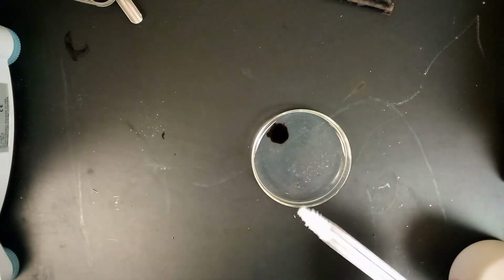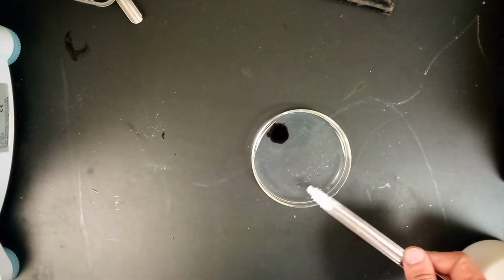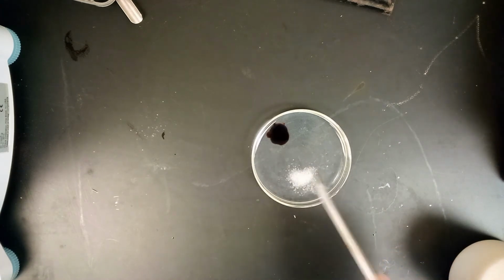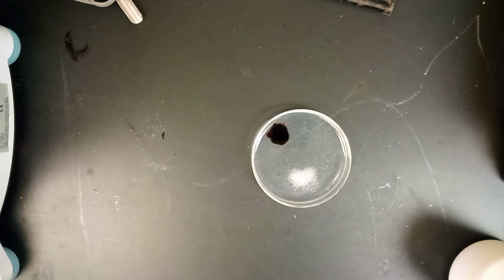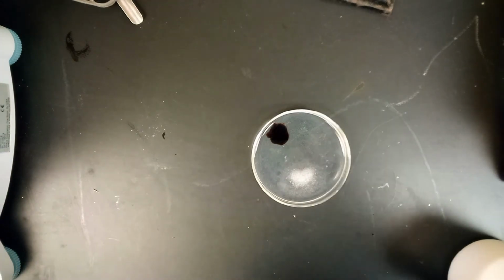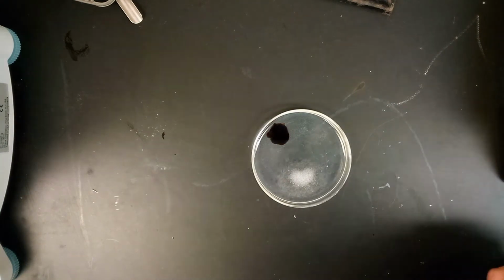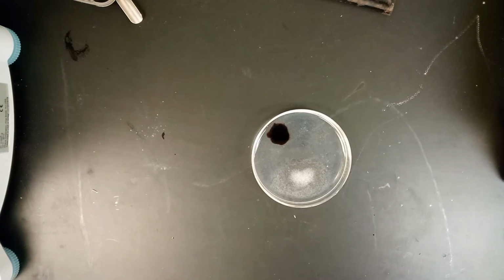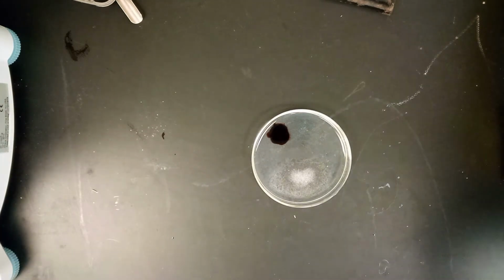This time you use a whole pea of these potassium thiocyanate crystals, add it to another part of the petri dish, like so, and record any color changes around the potassium thiocyanate this time around.